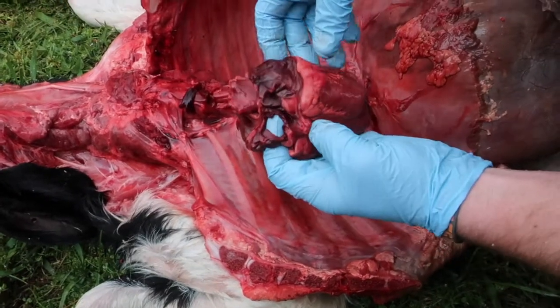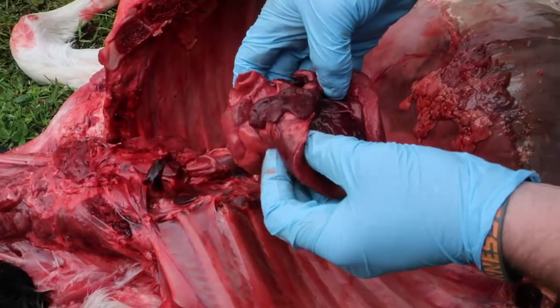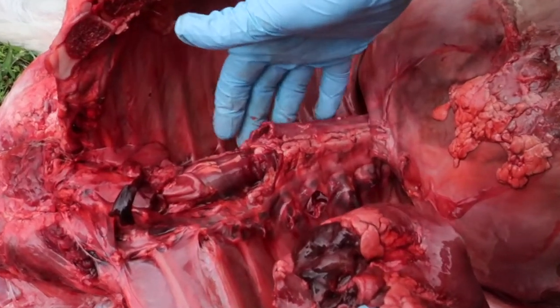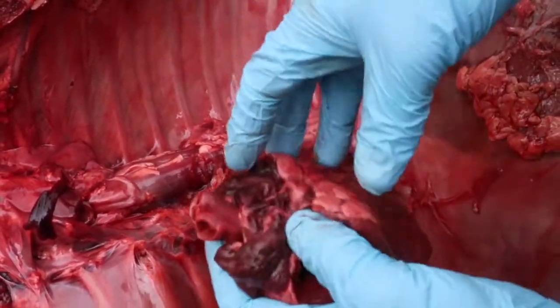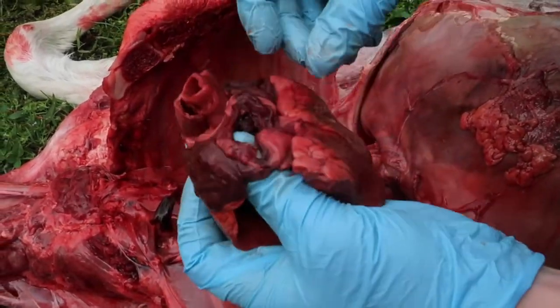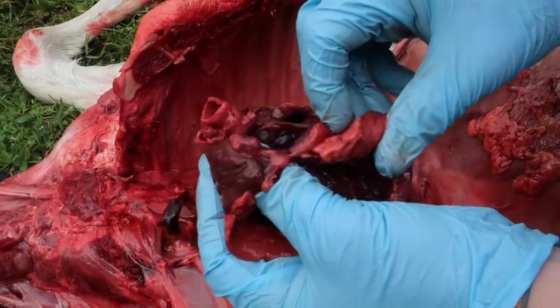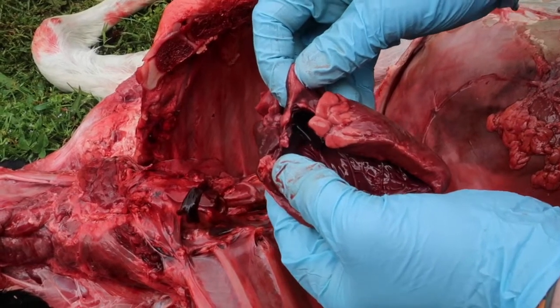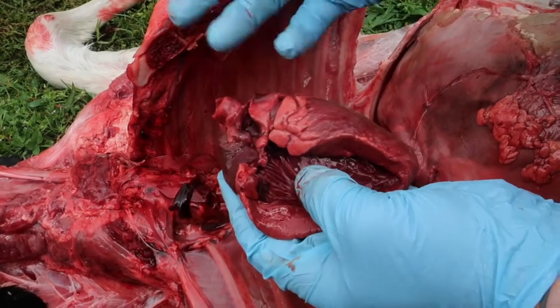Okay, so what I've done here now is I've dissected out the heart and also the lungs for you, and I just kind of want to walk you through some different parts of the heart. We did show you earlier the aorta leaving the thoracic cavity, going into the abdominal cavity through the diaphragm here. But when we look at the heart, I just want to show you some different structures. Let's just start over here on the right side. So as blood enters into the right side of the heart, it's going to enter into the right atrium, and it's going to be deoxygenated blood coming back to the heart from the different tissues.